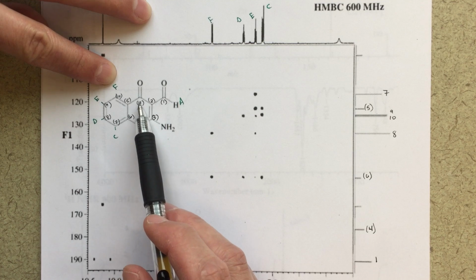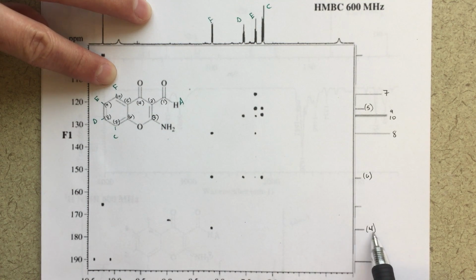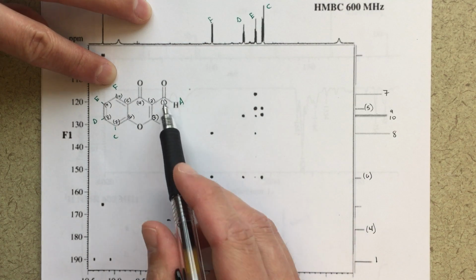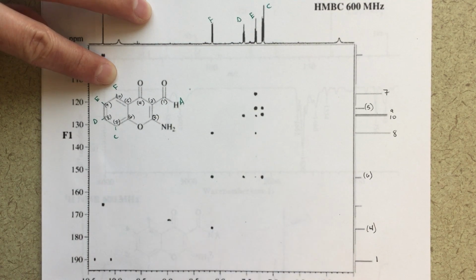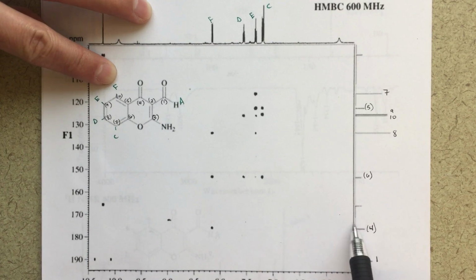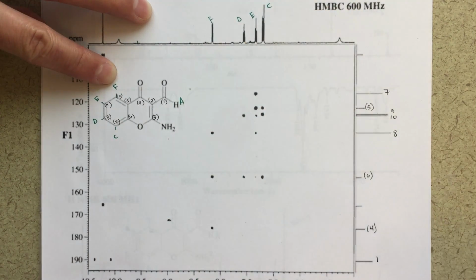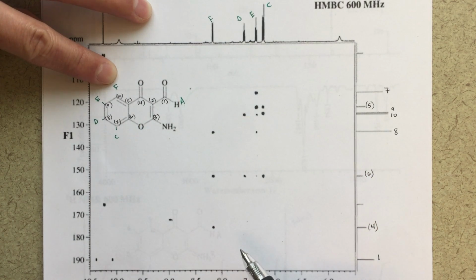So this carbonyl carbon, it should be further downfield. And so we know that 1 is way down here, right? So we'd expect that 4 to be further downfield as well. So we've got a nice peak there. This peak right here, I think this is just an artifact. It doesn't correlate really well with anything. There's no carbon here. There's no real proton here. So I would just ignore that. That's fine to do. Let's go back and talk about E now, see if we can make sense of that.